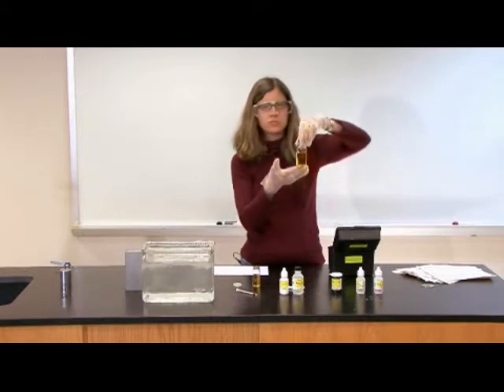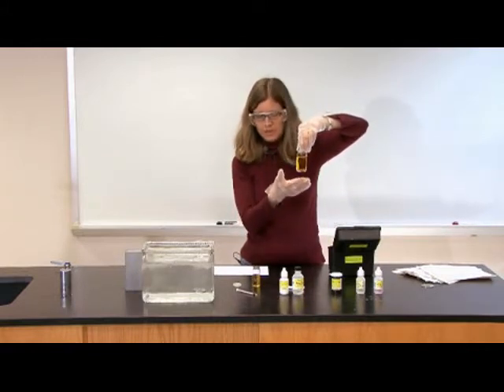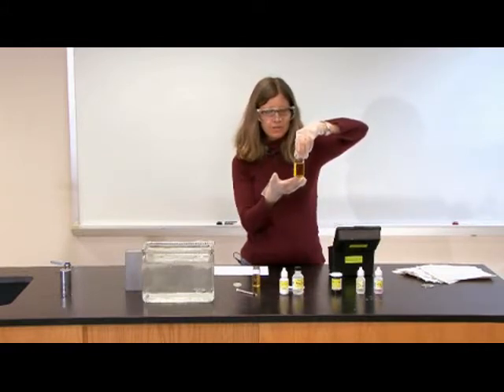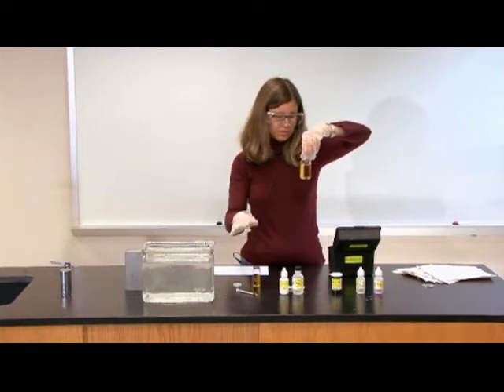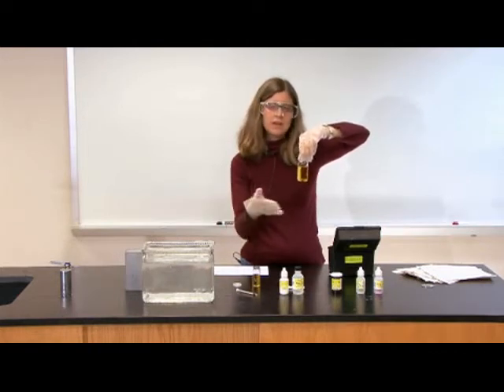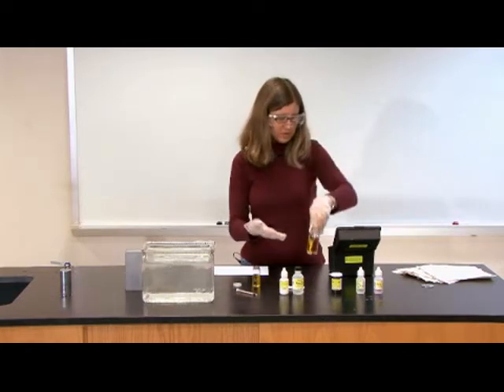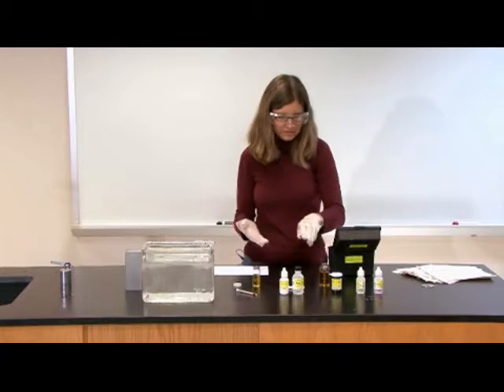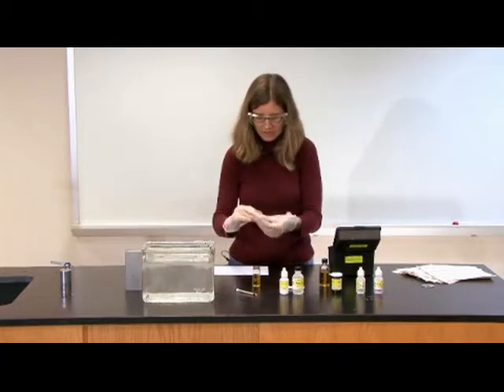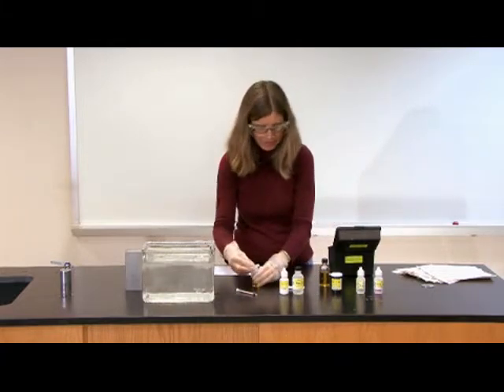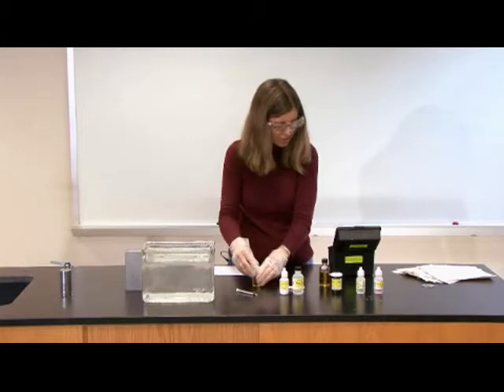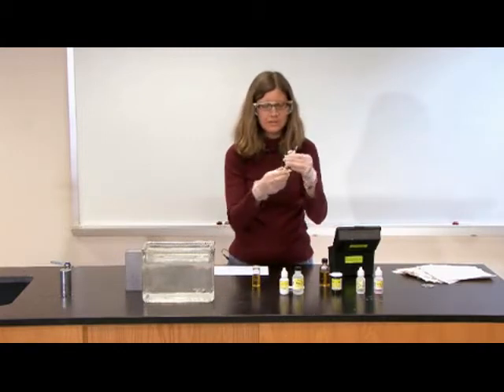And notice I have extra sample left over, so if I get, in general it's good to do the actual test procedure a couple of times, and you even have enough sample here to do it three times, so you can kind of check your work. So I'll save my fixed sample. I put this cap with a hole in it on my titration tube, and then I'm going to use this thing called a titrator.